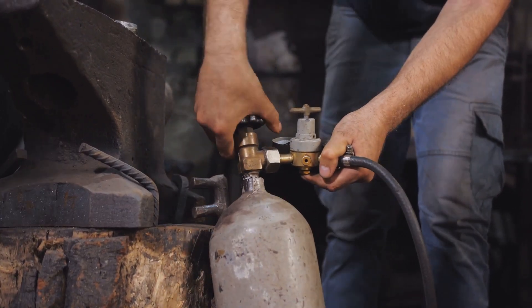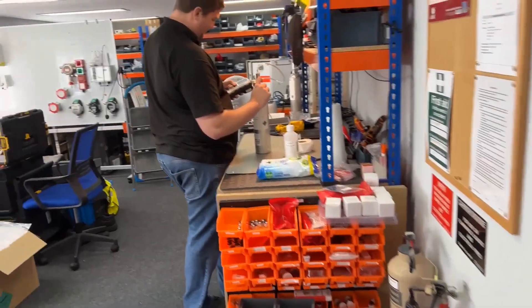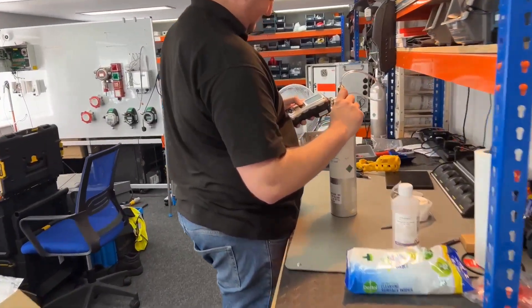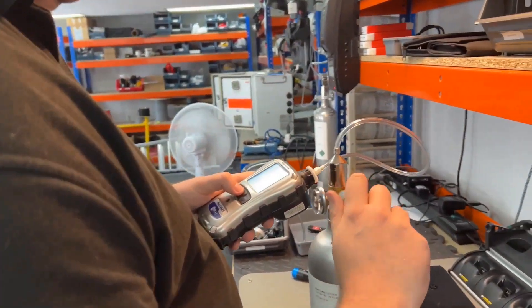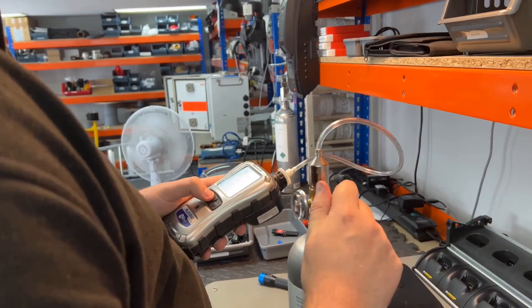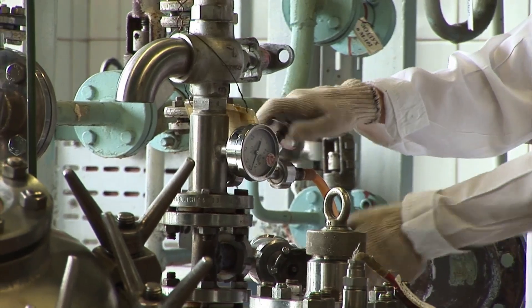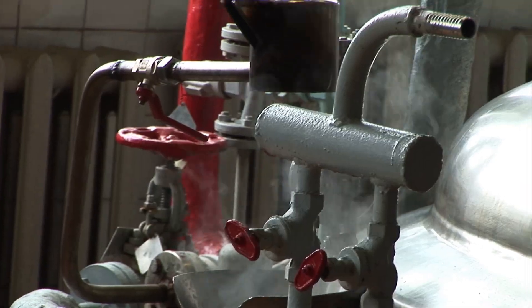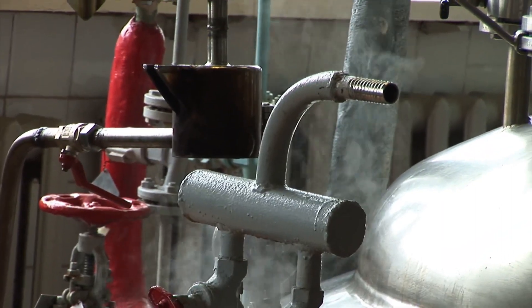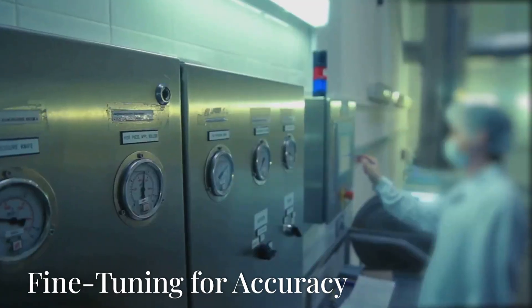Calibration ensures your PID provides accurate readings. Isobutylene is the standard for PID calibration, offering consistent responses. Regular calibration with known concentrations keeps your PID reliable.